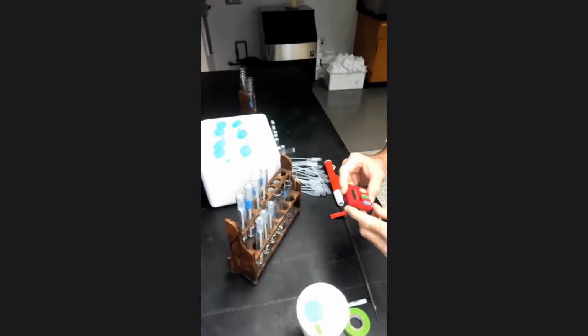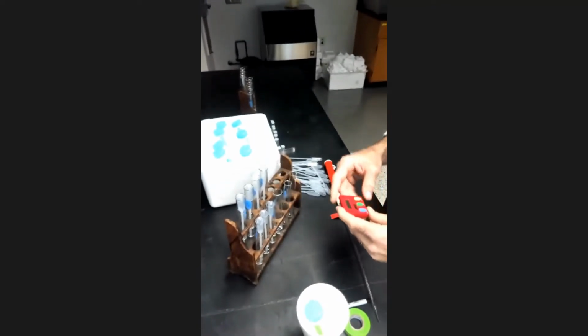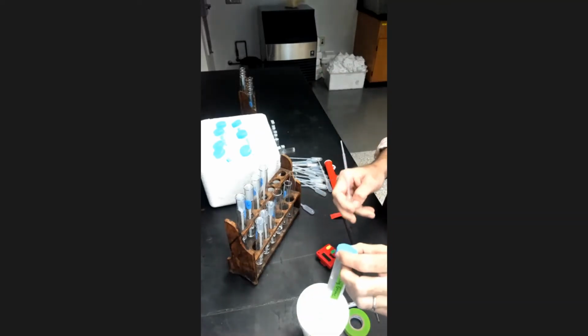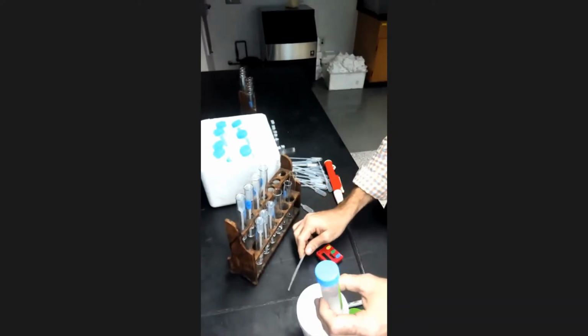So what I will do is use a timer, and every 20 seconds I will add another 1 mil of working enzyme into the next tube. So when it comes time to stop the reactions, I can stop them on that same scale of time. So I'll turn my stopwatch on here, and the moment I add my working enzyme into the first tube, I'll start it. And then again, every 20 seconds or every 30 seconds, whenever I just need to establish exactly how long I'm going to give it, I will then go into the next tube.